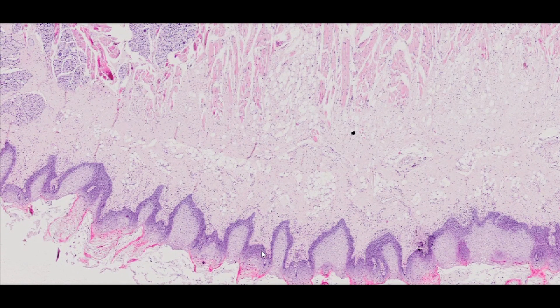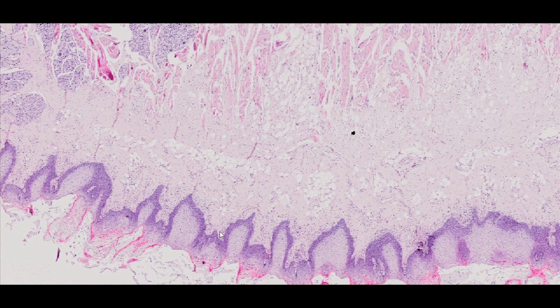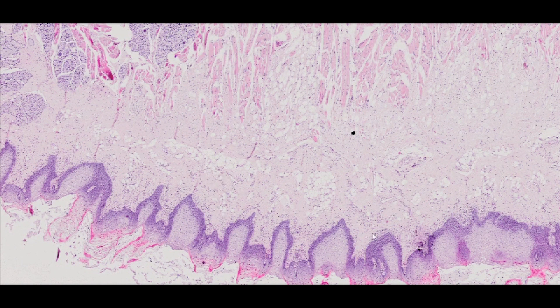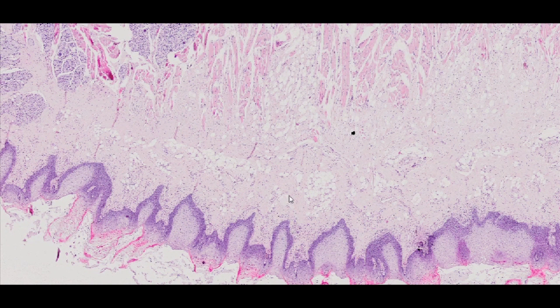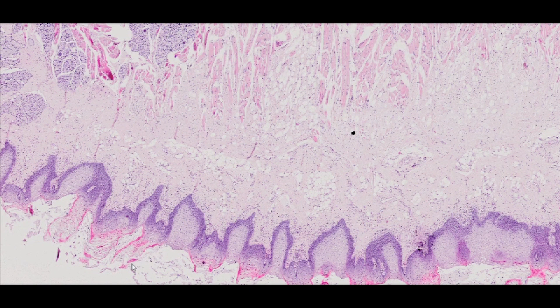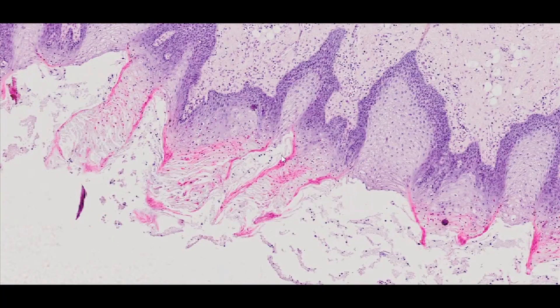Here we can see the dorsal part of the tongue, covered with stratified keratinizing squamous epithelium and the underlying loose connective tissue proper, which forms the mucosa lamina propria. The epithelium forms multiple projections into the lamina propria, which also projects into the epithelium, forming primary papillae. Since most of the papillae are the filiform type and perform mechanical functions like grinding food, their epithelium is strongly keratinized.